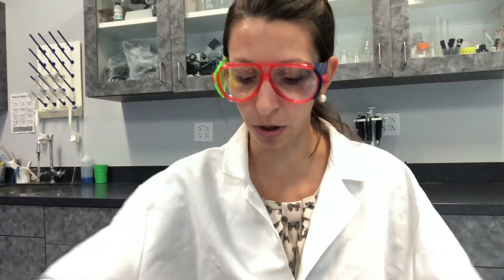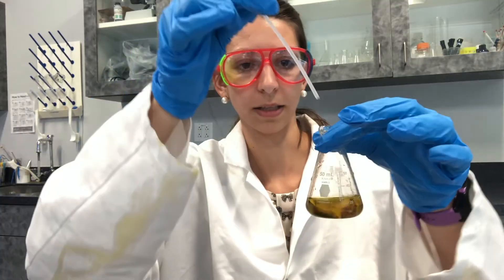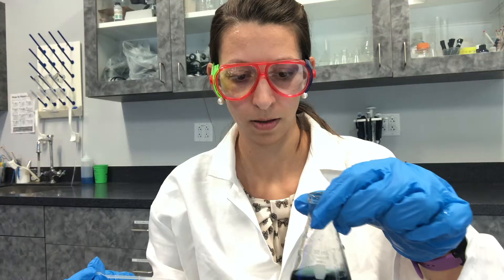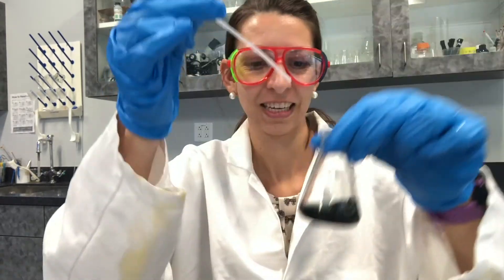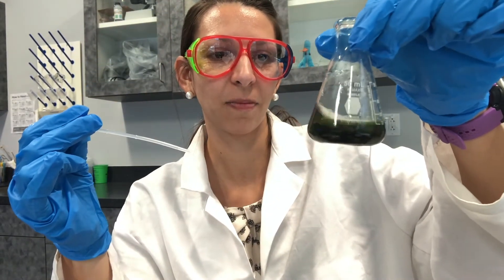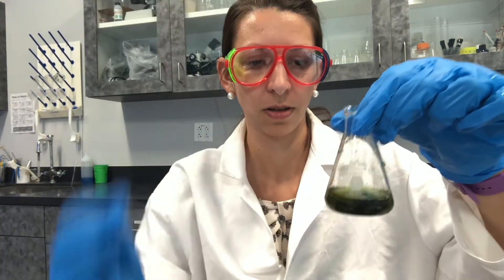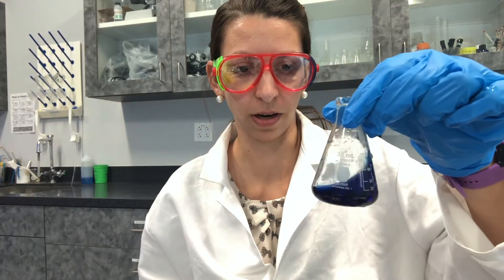Very carefully take your aluminum foil off, take your straw out, and remember NaOH can be corrosive so handle it carefully. One drop — oh well, that didn't take very long. We'll swirl it around a little bit — it's still kind of greenish, so we'll do two drops and swirl it around again. It is staying blue. All right, so that was two drops.